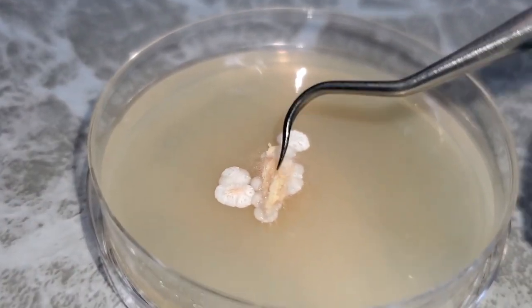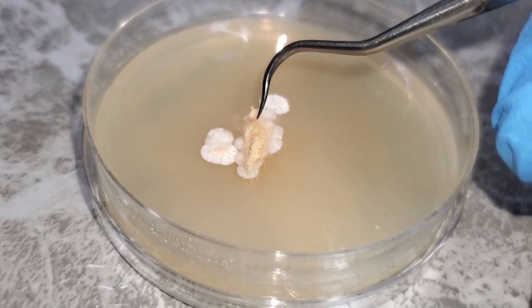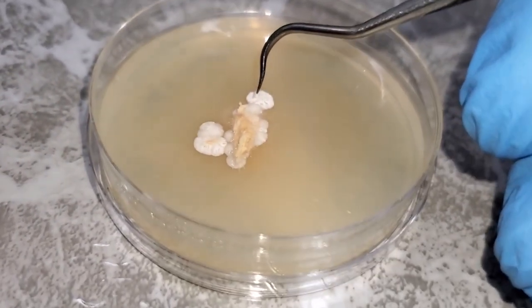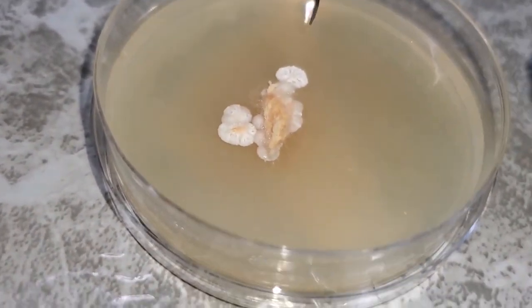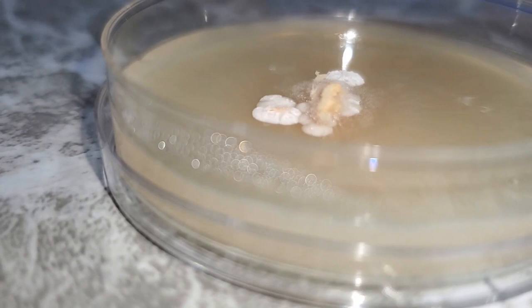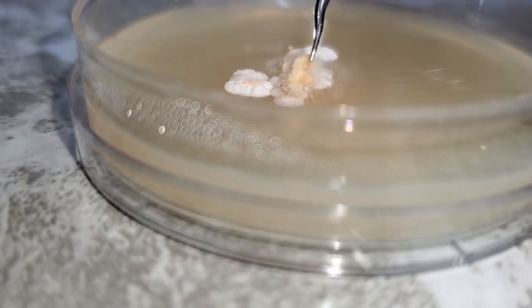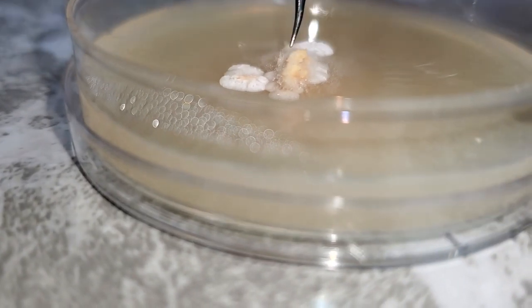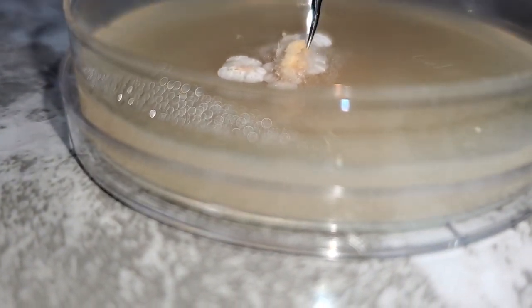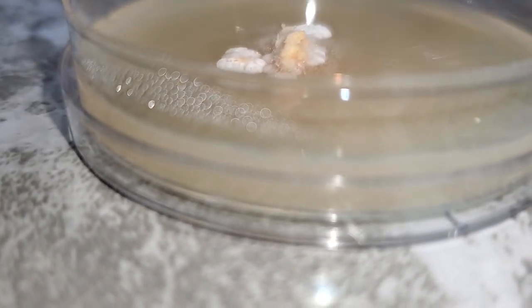You can see this part right here is the actual piece of tissue that was extracted from the middle of the chicken of the woods shelf, and then cut out under sterile conditions and placed onto this 60 millimeter agar petri dish. You can see how this part is starting to put off some new mycelial growth. That's the mushroom, well, this piece of tissue trying to grow outwards into the petri dish and put off extra mycelium, trying to recolonize this petri dish from that tissue sample.